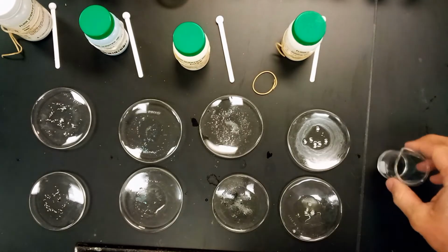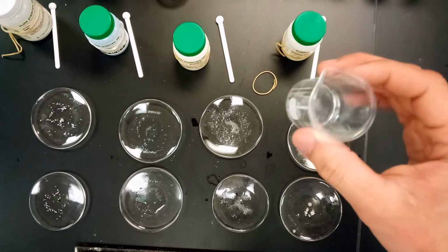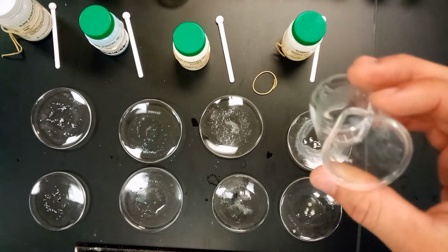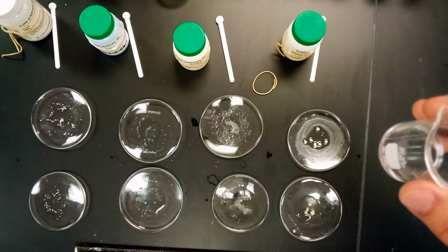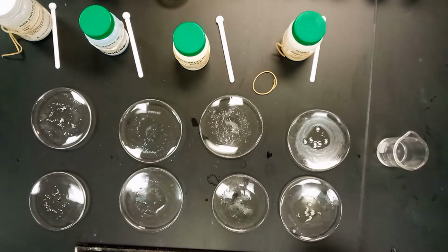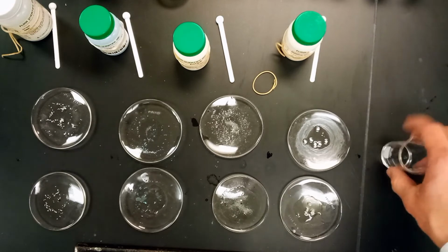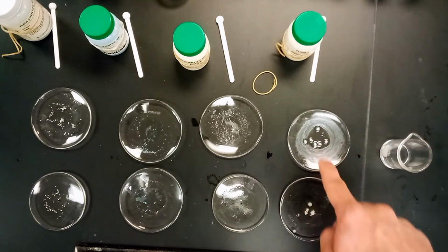So we let this hexane and the paraffin wax sit for a little while, and the paraffin wax has actually gone into solution, believe it or not. It's kind of hard to believe, but paraffin wax, we know, is a non-polar covalent bonded material, which should dissolve in hexanes since they are also nonpolar. So that is something that happens. It's just hard to see with such a small amount of hexane and so much of the paraffin wax.